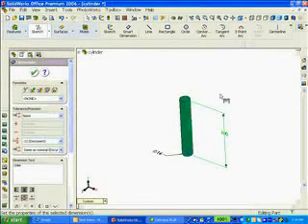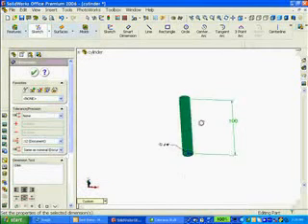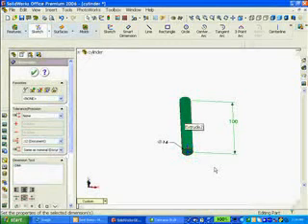Let's take a look at adding the bowl of the test tube on the bottom. That rounded face happens for a lot of different reasons. Samples are collected at the bottom of the test tube. The geometry allows sediment to collect at the bottom. Sometimes you want to aspirate at different areas along the test tube and you don't want to disturb the sample that's at the bottom. So we need to create a rounded bottom for our test tube.